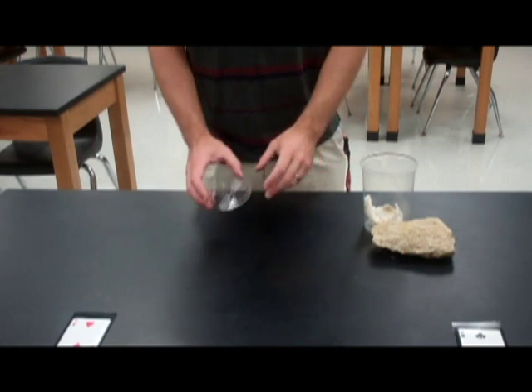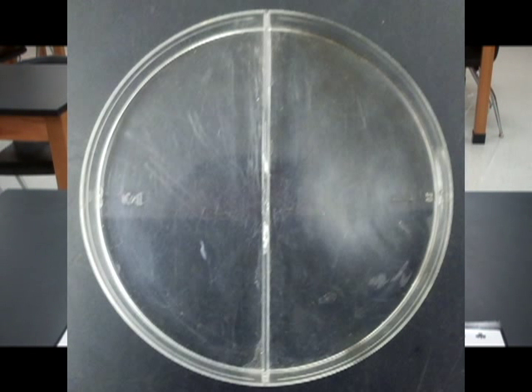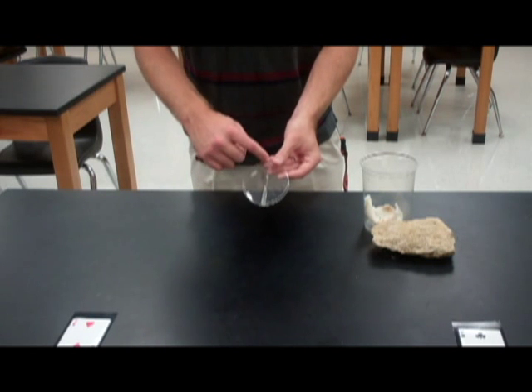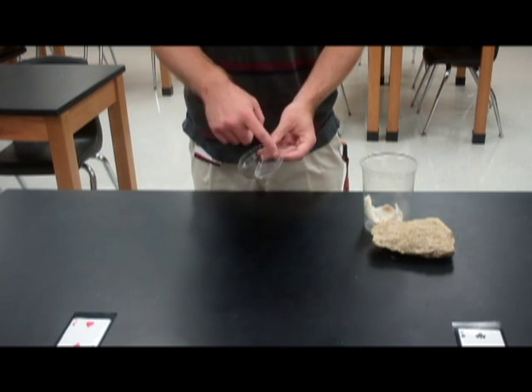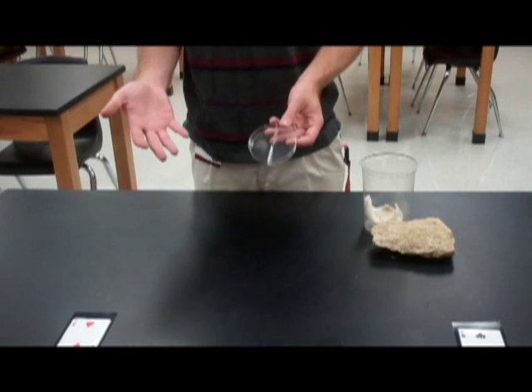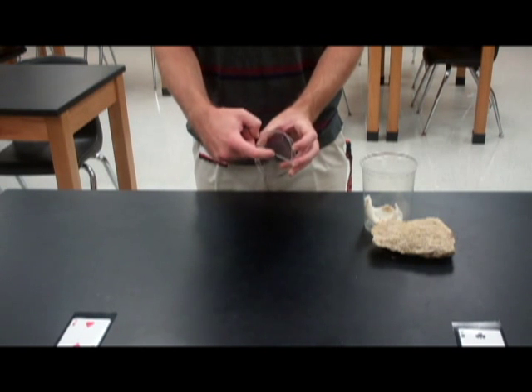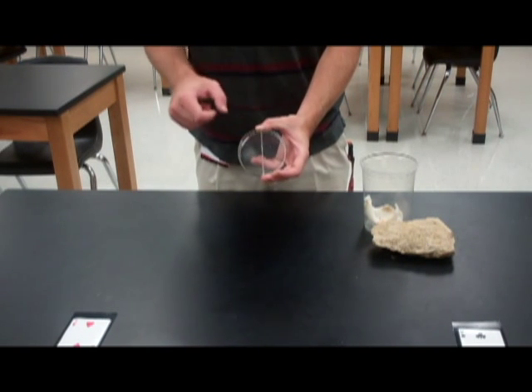Whenever you're setting up your choice chamber, it's going to look something like this. It's basically a petri dish that's divided in half, usually used for microbiology. You can buy double sided, three sided, or even more chambers in a choice chamber, and all you need to do is knock out a door in the middle so they can choose between the two sides of the chamber.